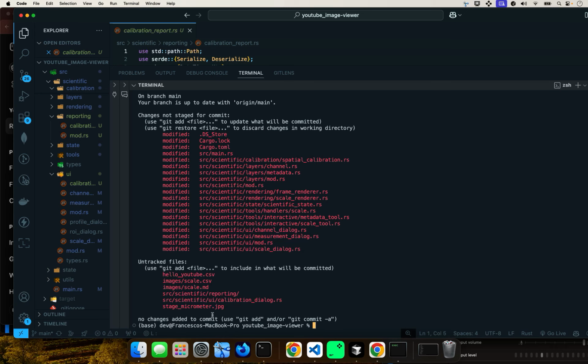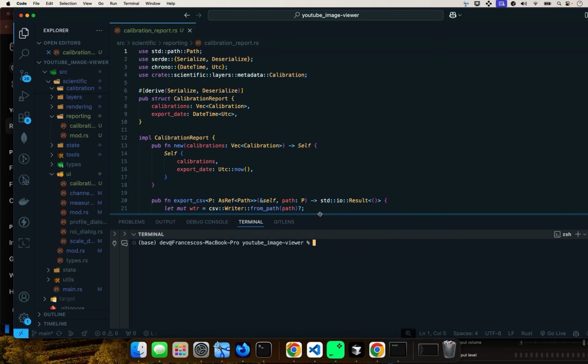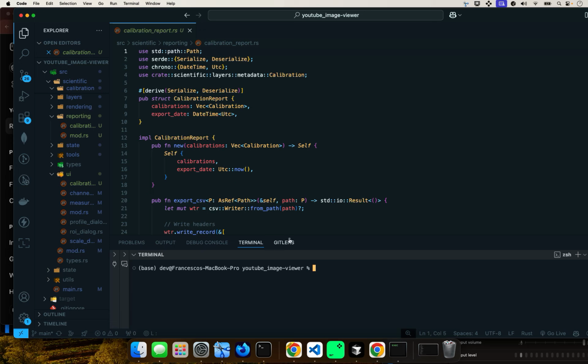These are the new files that I created, and some of them were modified a little bit, some more than others, but these are the new files. These were existing files that I modified. So let's just clear this, and these are the files here in green that I created. These are completely new. So the first one is this one, calibration report, and I'll just explain the code to you because this is new.